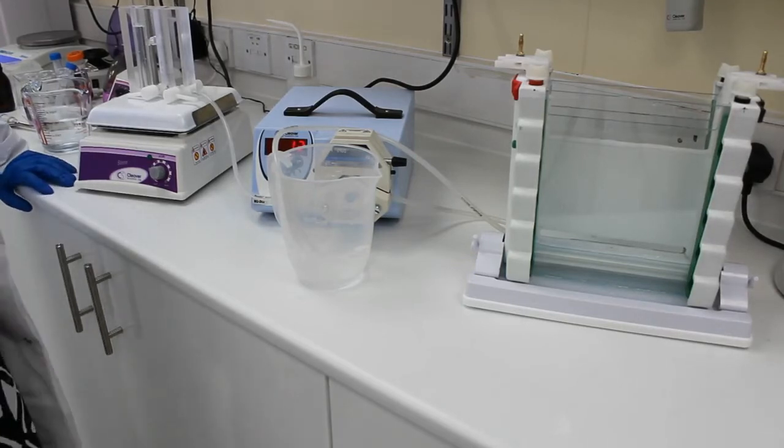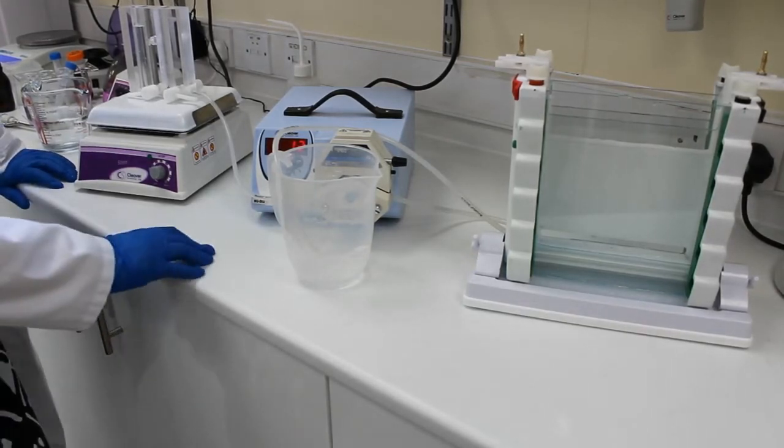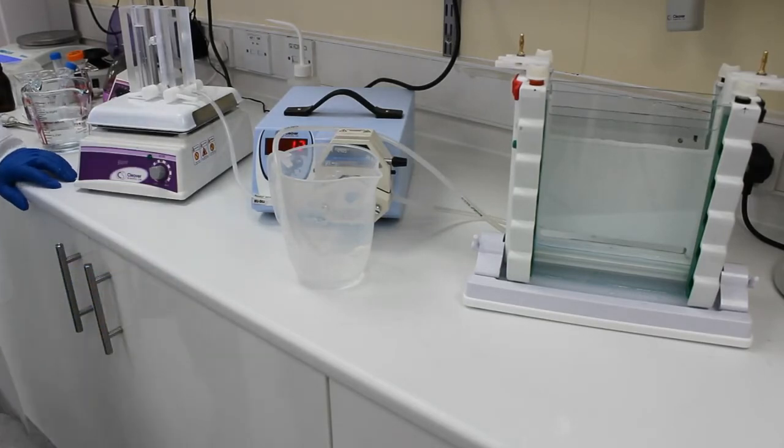Otherwise the gel will polymerize inside the gradient mixer and when we try and pour our next gel it will all be blocked up and we won't be able to do anything.